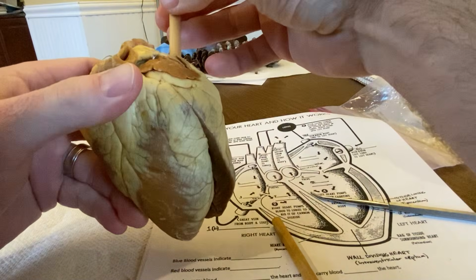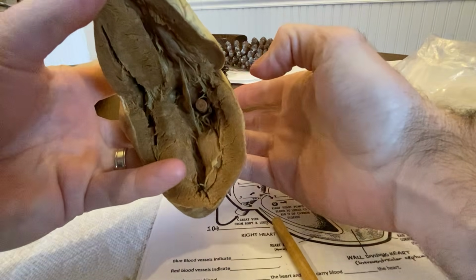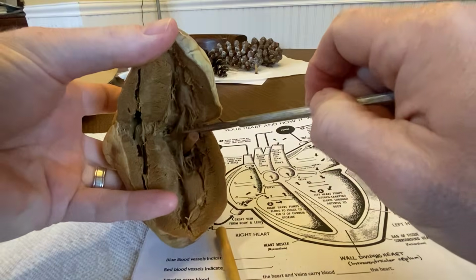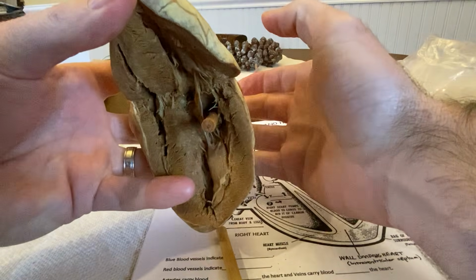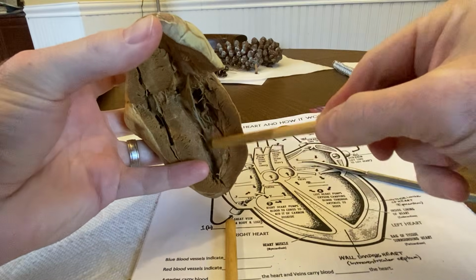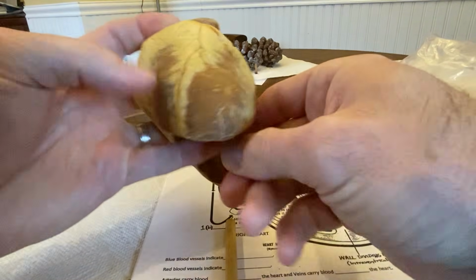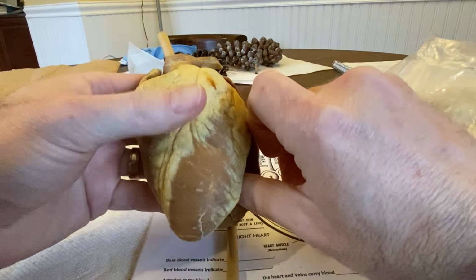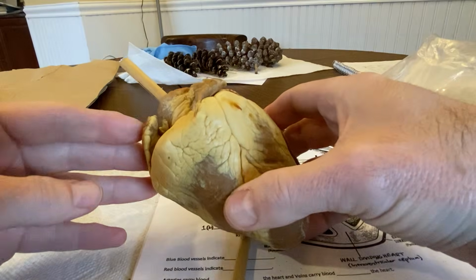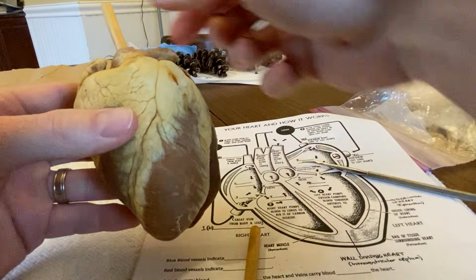That would fill, squeeze the blood down through the bicuspid valve, coming right towards you guys through that bicuspid valve. So remember, the parachute here is the actual valve. So it's coming through the valve, fill this whole ventricle, okay, and then squeeze right on up and out the aorta to all destinations of the body from there, right? So that's kind of our pathway of the blood going through the heart, all right?